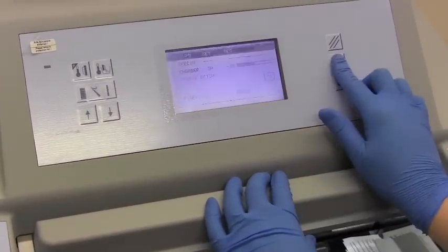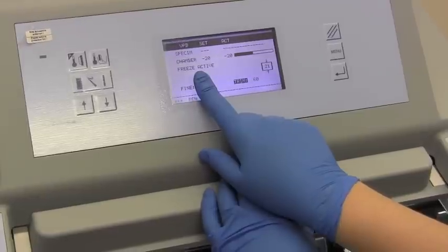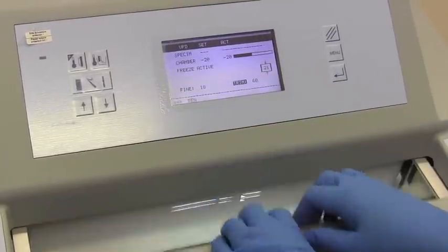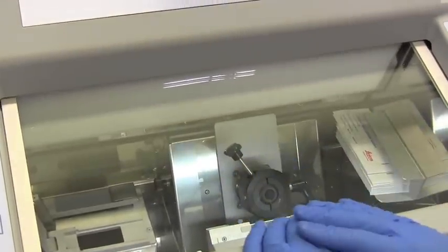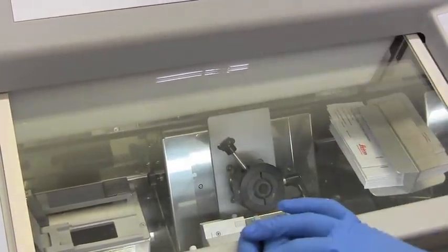And then we put it onto the Peltier station again, and remember you have to go to the menu, turn it on to cool, and press enter, and you will see freeze active because it only goes for about five minutes. And then we're going to wait until it's solid, and then we can mount it and we can do the cuttings.